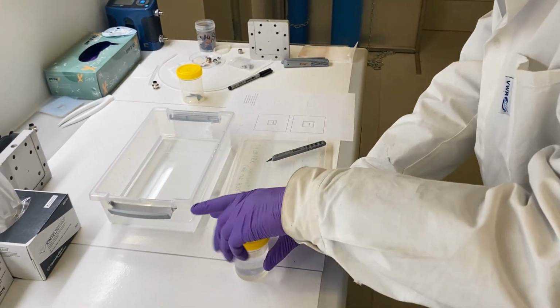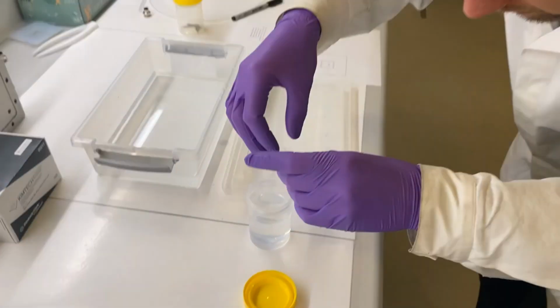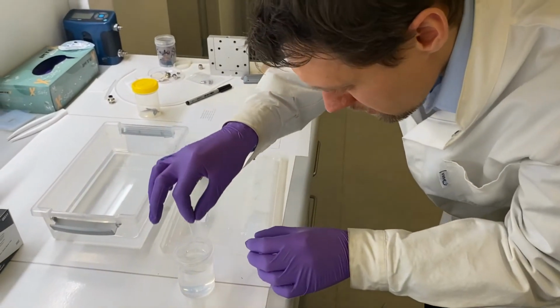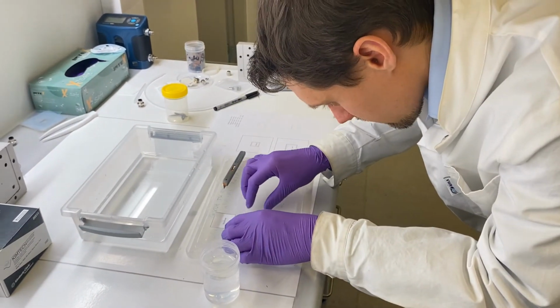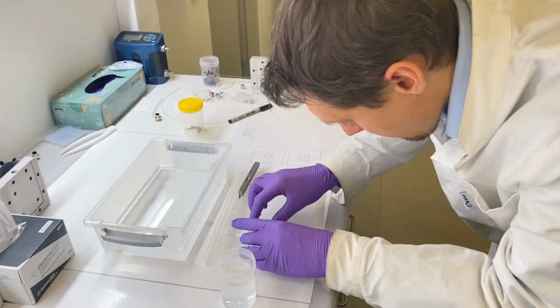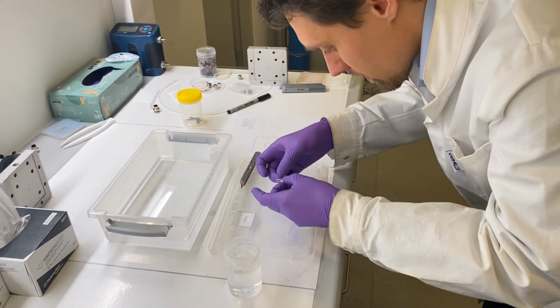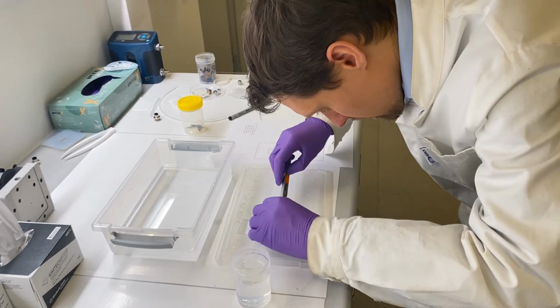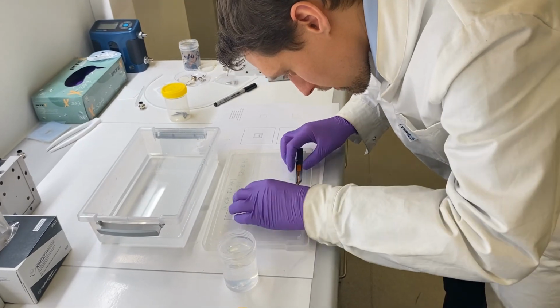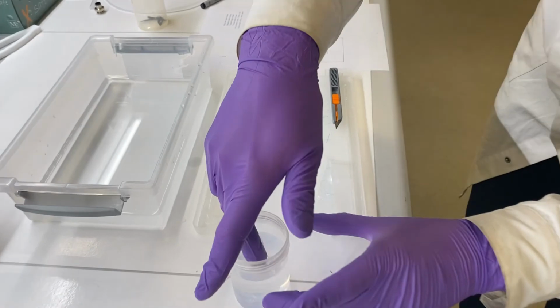And then I put them in a small container, ready for use later on. All with nice clean edges.